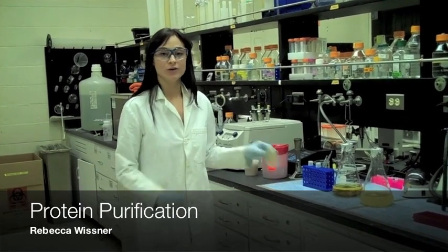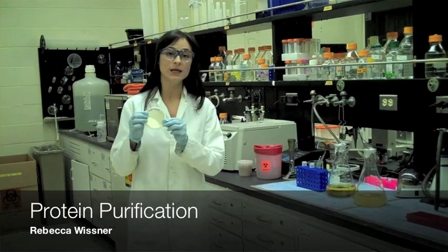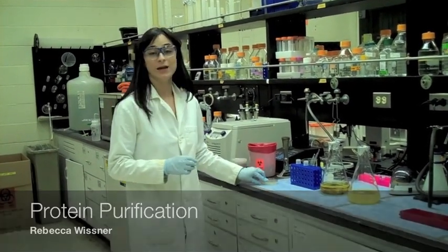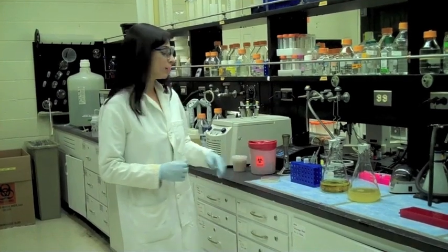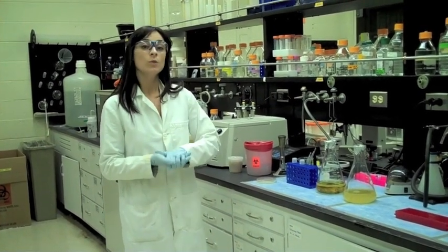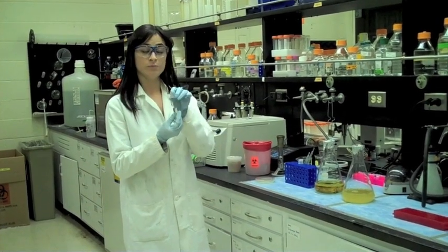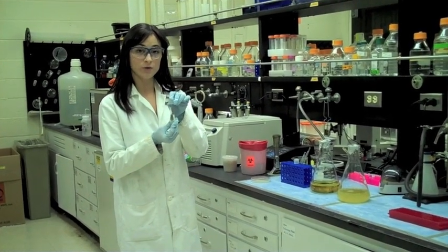Anne already taught you how to grow single colonies of bacteria on a plate. In order to express protein, the first step is that we must amplify this bacteria. In order to amplify the bacteria, we will pick a single colony from the plate and inoculate a small 5 milliliter primary culture.